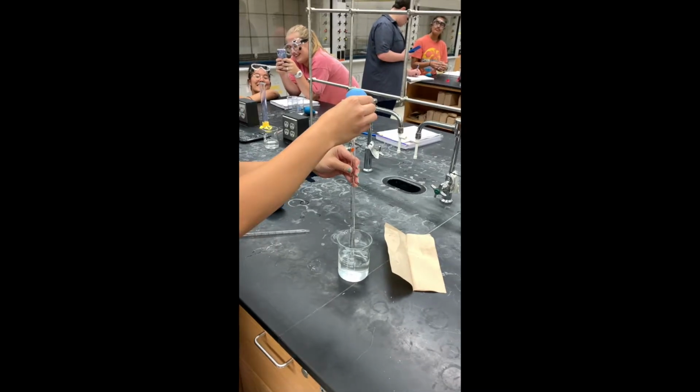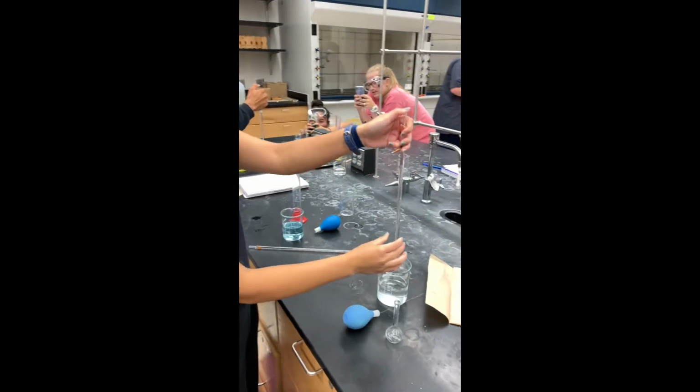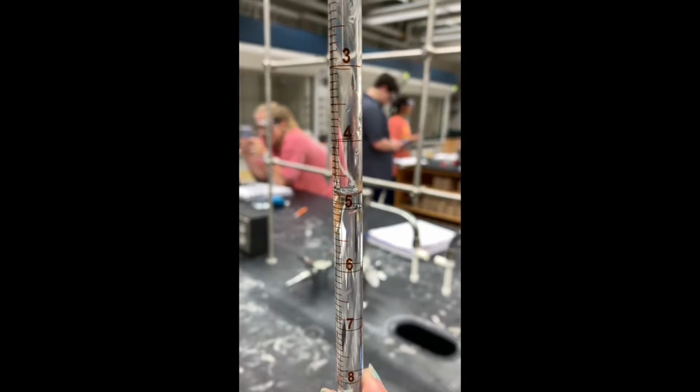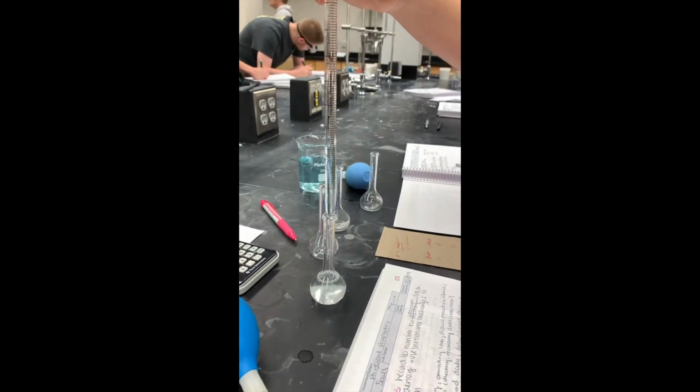First thing to do is to make sure you are wearing your goggles and you have all of your equipment. Next, take a full 25 milliliters of the sugar solution and place it into the volumetric flask. You can retrieve the correct amount using a graduated cylinder or a graduated pipette. After pouring the solution into the flask, measure it on the scale.